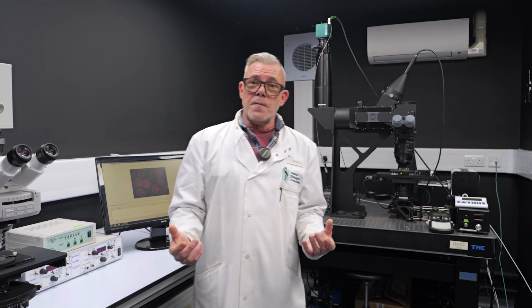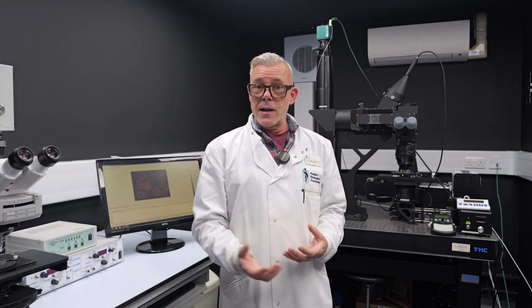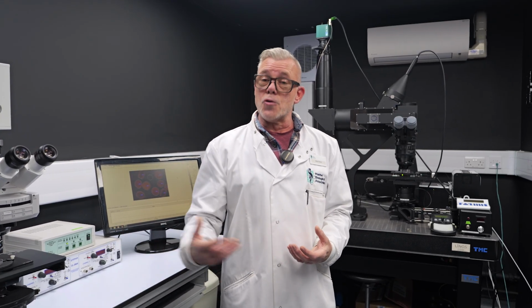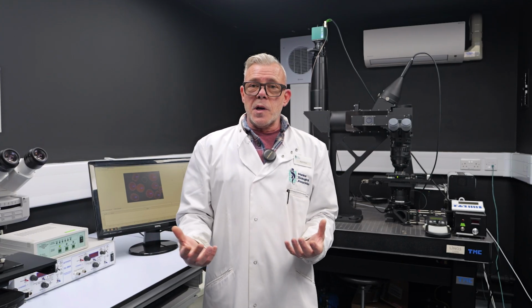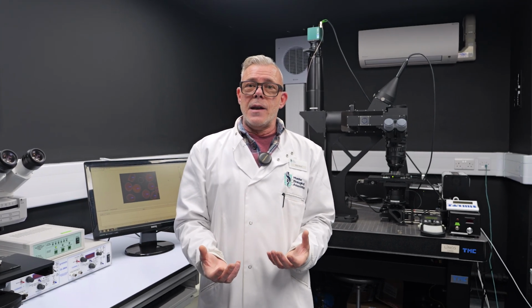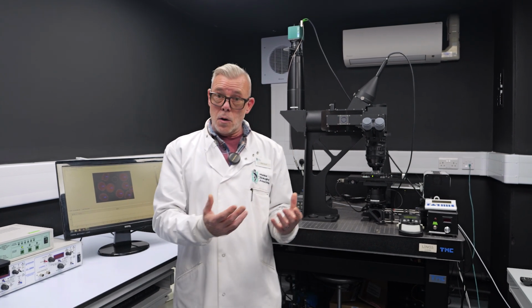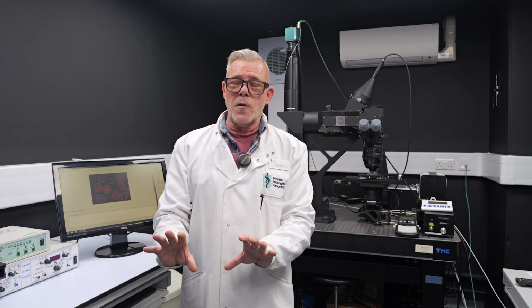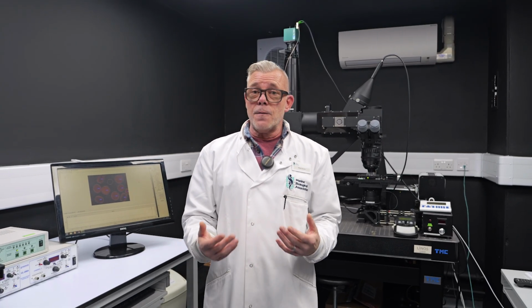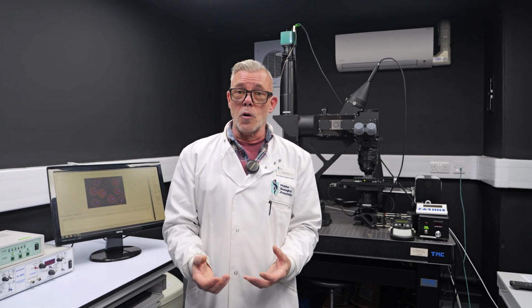During photosynthesis, phytoplankton are absorbing sunlight, incoming photon energy, that they then convert into chemical energy to drive the whole photosynthetic process. Phytoplankton, like all plants, aren't able to cope with all of the incoming sunlight energy. So some of that energy needs to be dissipated. And in the case of chlorophyll, it does that by fluorescing, or reflecting some of that light back. And we're able to take advantage of that by measuring the intensity of fluorescence that's produced by chlorophyll.